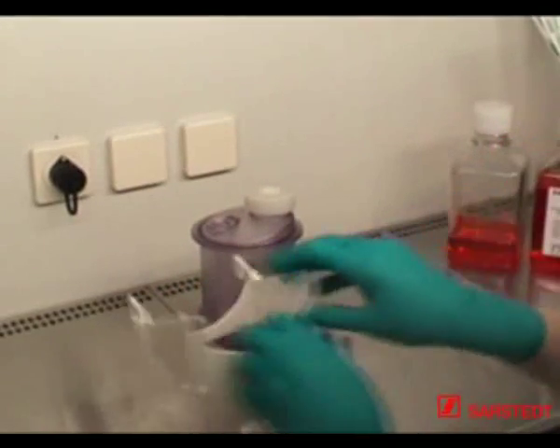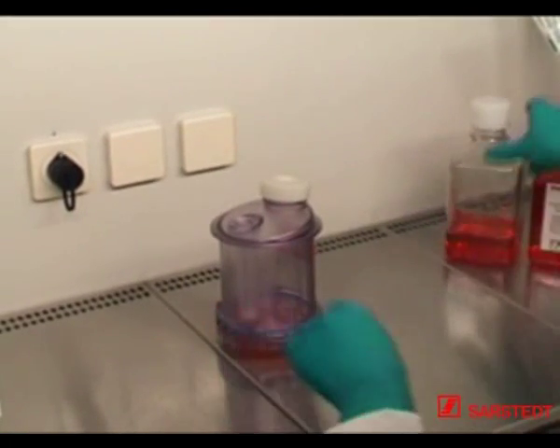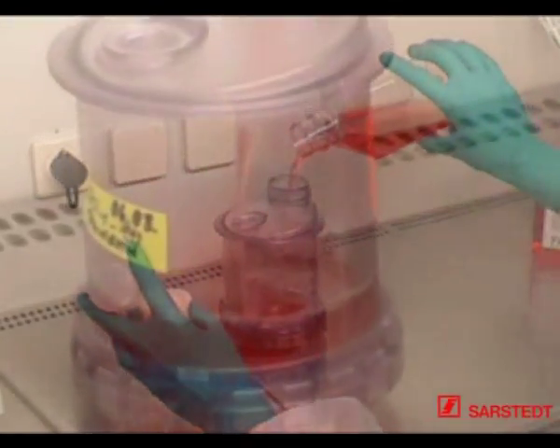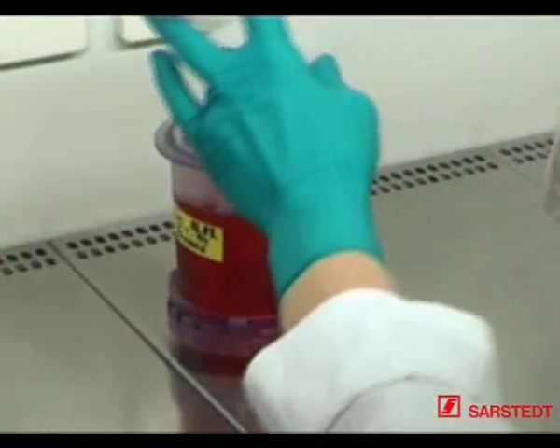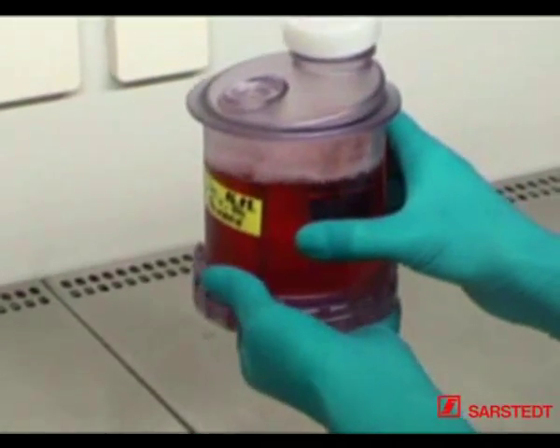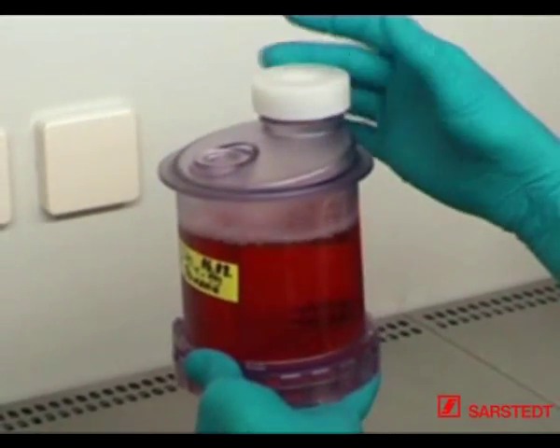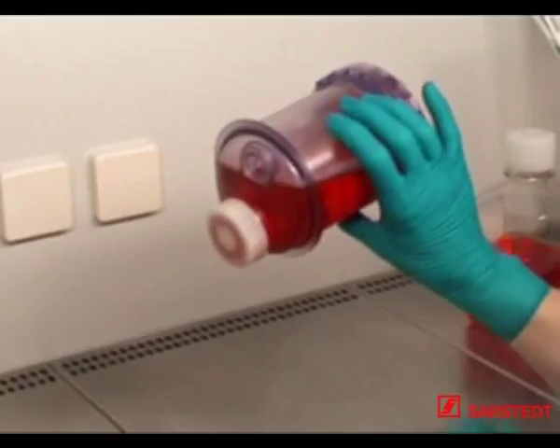Close the production module with a screw cap or septum cap, and pour no more than 350 to 400 ml of a tempered medium into the nutrient module. Do not exceed this volume because the gas phase in the nutrient module is a basic prerequisite for successful culturing. To equalize the pressure building up inside the bioreactor, press one hand against the silicone membrane and tightly close the neck opening with a screw cap. The MINI PERM bioreactor can now be placed onto the universal turning device in the incubator.